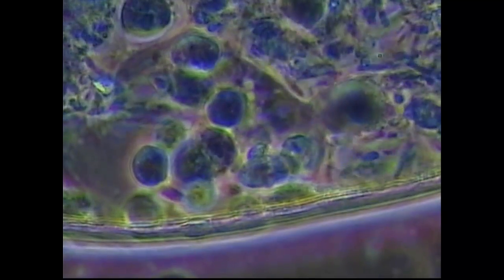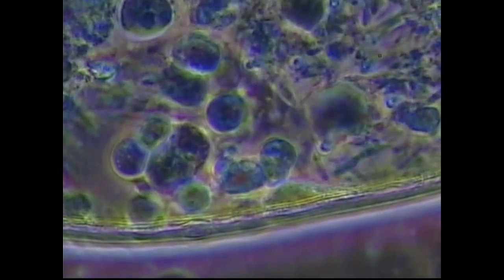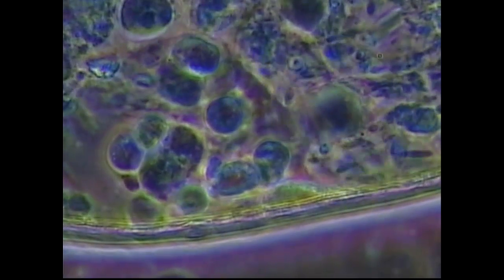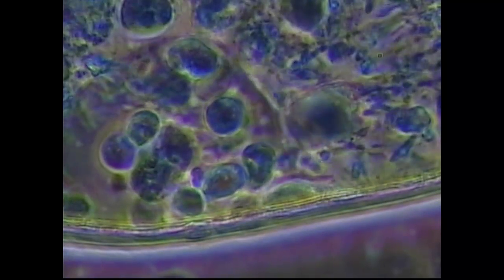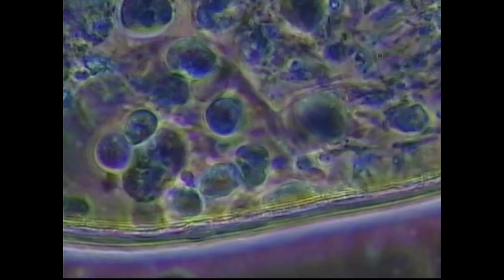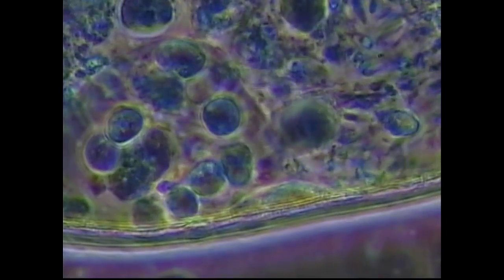I would love to be able to follow this guy and see if he really makes it, because once something's inside the amoeba, it really has a way of just dissolving it and excreting the toxins from it. So I'll keep the slide on this amoeba for a little bit.